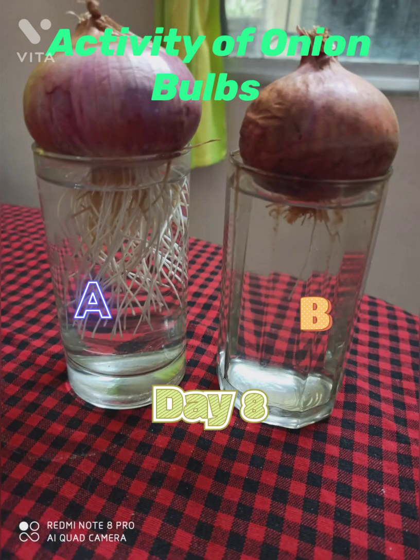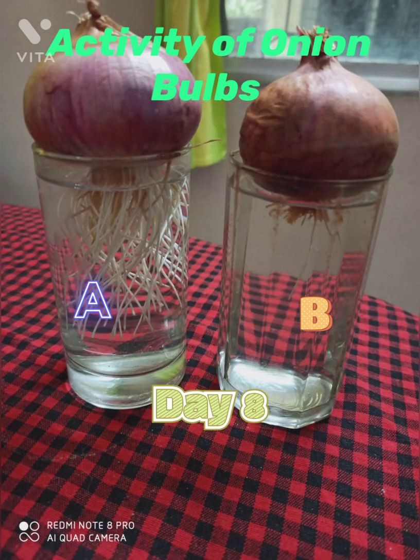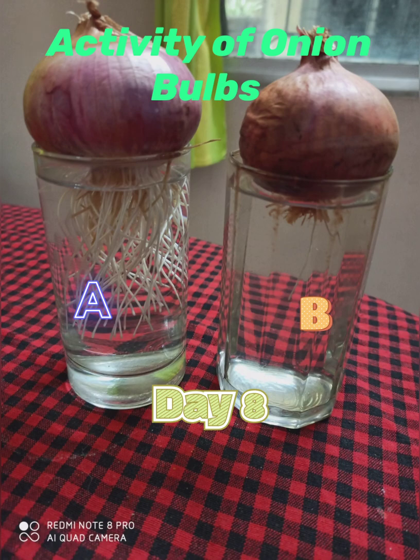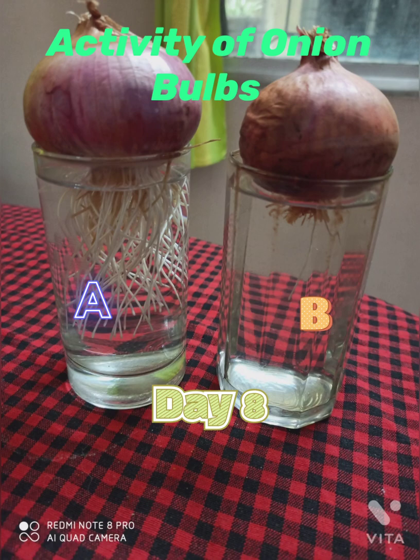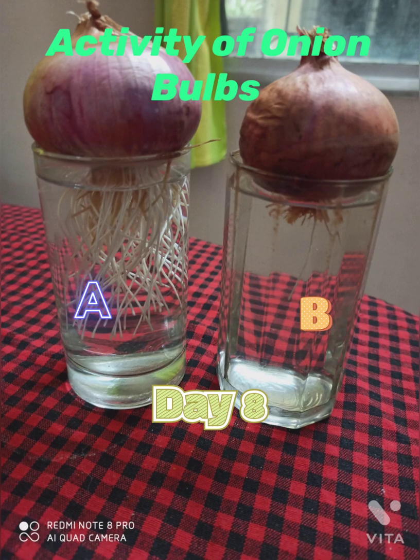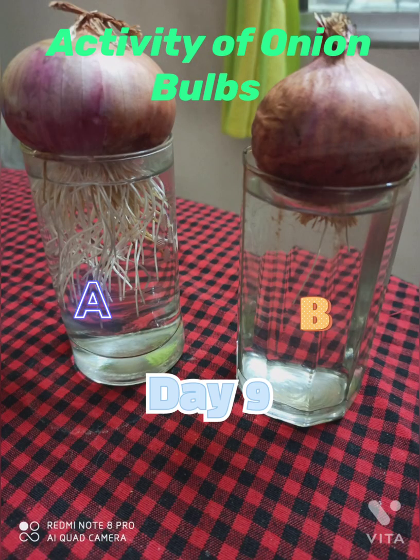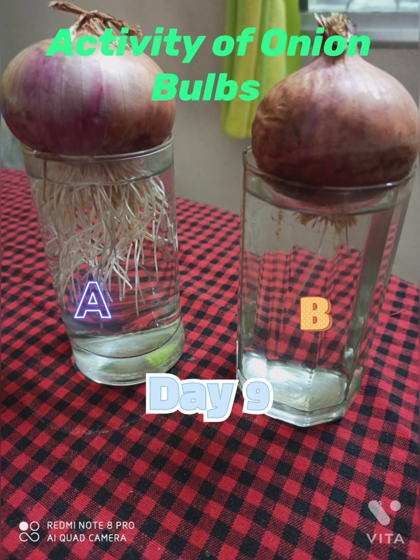This is the observation for day 8. As you can see, in beaker A the roots have covered more than half of the beaker, whereas in beaker B the roots are not growing as we have cut the root tip.